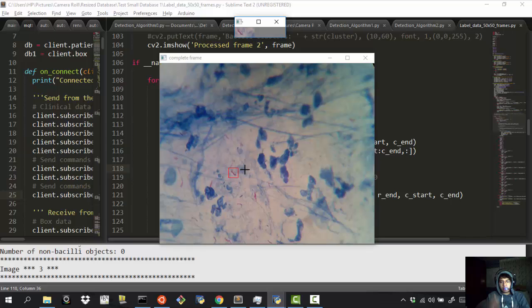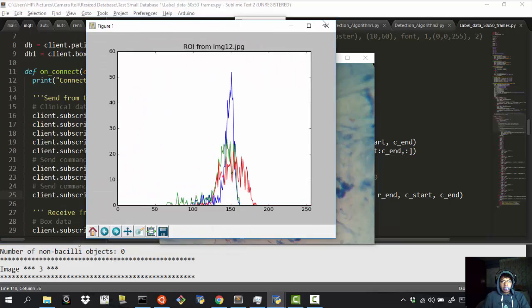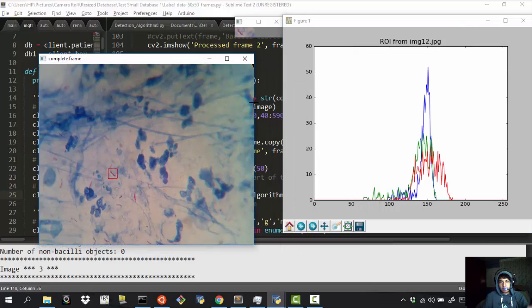Over here you have a small blob that shows where you are. If you press H whenever you are here, that's going to compute a histogram of that part of the image. As you can see, here we have a high level of blue, of course, as in all the parts of the image. You can download this program to play with it. Remember that this is useful for anything that you can see on the microscope. With the automatic digital microscope, you can do that.